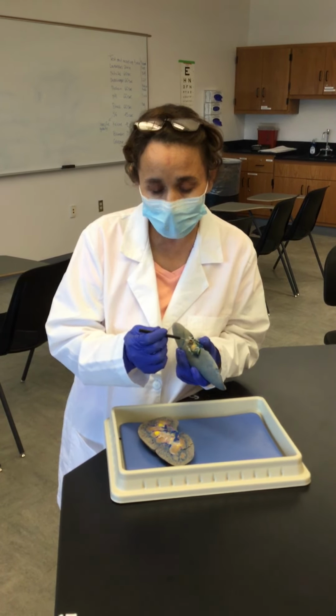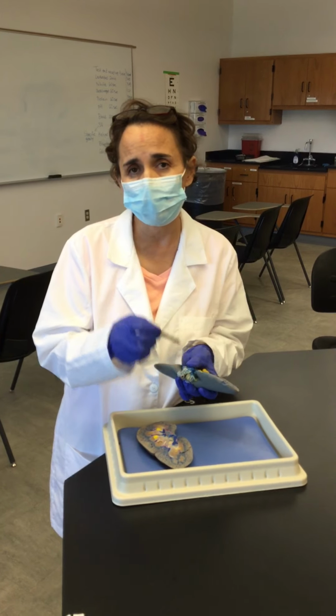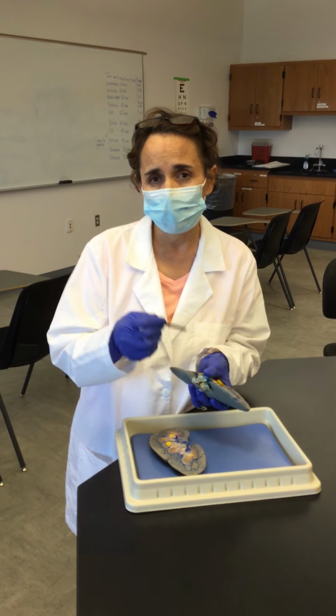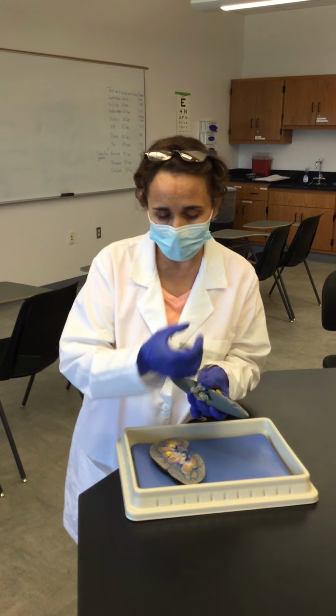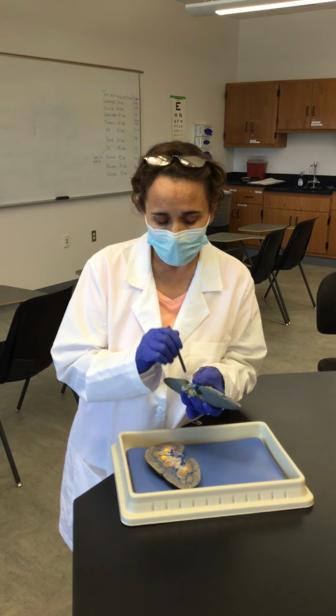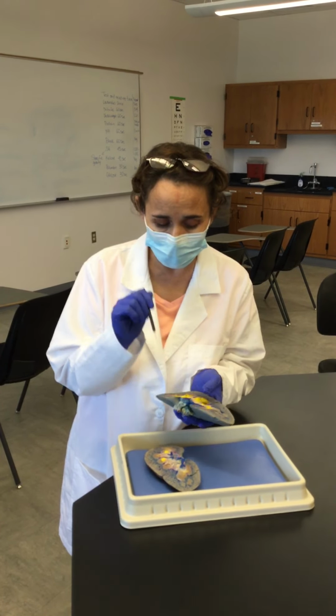And then if the diameter is very large and the lumen is round and the wall is soft, that will be the ureter. And actually you can tell also that this is the ureter because the ureter is the tube that brings the urine from the kidneys into the urinary bladder, and this is stained with yellow. So there is no doubt this is the largest of all the lumens or diameters, the one for the ureter.